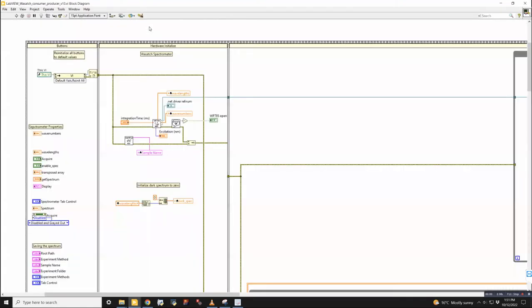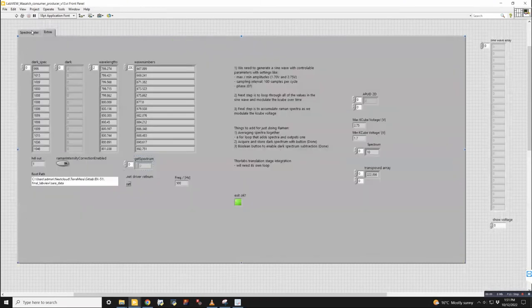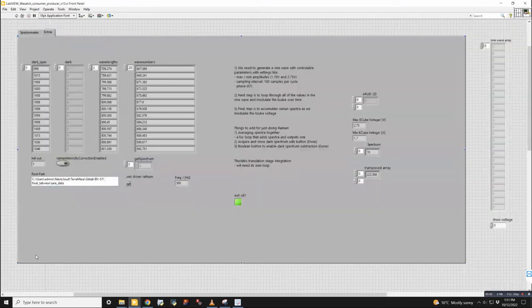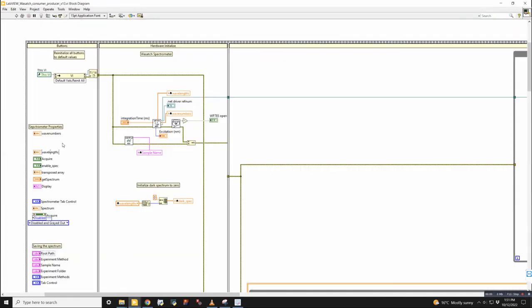So going into the back panel on this, LabVIEW typically runs left to right, but it's controlled by wires in terms of the information flow. So in terms of organization and overall runtime, we start with the buttons on the left-hand side. So these are all the actual buttons that you can interface with on the front panel. So you can see like this is the actual tab control. This is like a root path here. And keeping all the buttons here is really nice to stay organized.